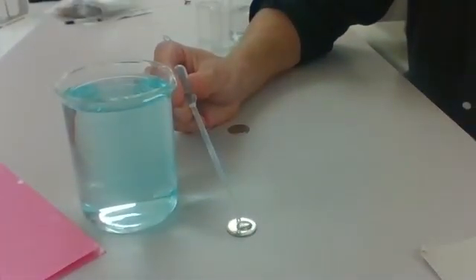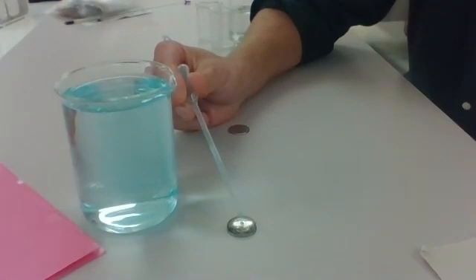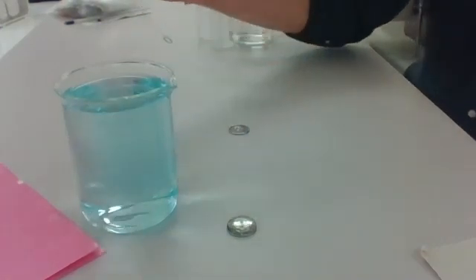One, oh, you can't see that one. 2, 3, 4, 5, 6, 7, 8, 9, 10, 11, 12, 13, 14, 15, 16, 17, 18, 19, 20, 21, 22, 23, 24, 25, 26, 27, 28, 30. There we go. 30 drops of water on a nickel.